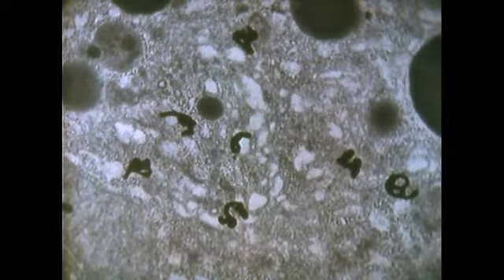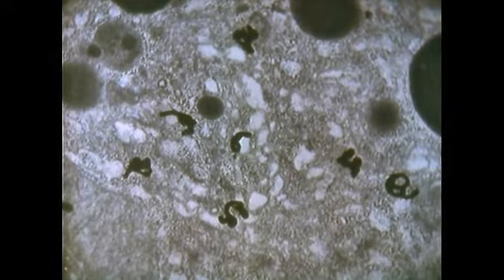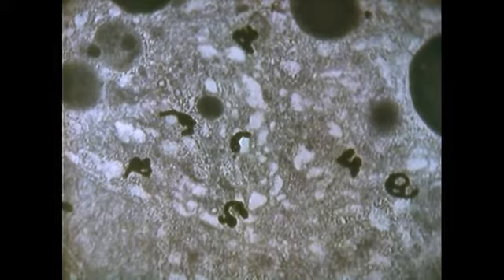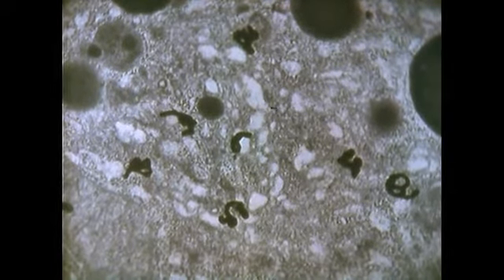The preparations with the autoradiographic grains on them are examined in the electron microscope. And what we see here is the situation found at the end of the pulse. The autoradiographic grains are over the endoplasmic reticulum. After 10 minutes of chase, the grains move from the endoplasmic reticulum to the periphery of the Golgi complex.